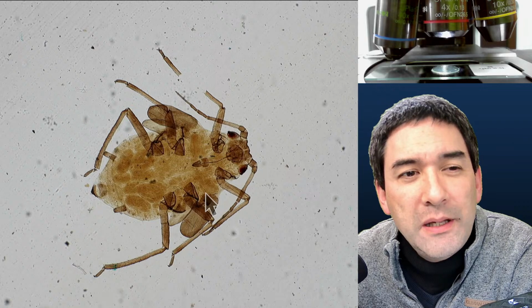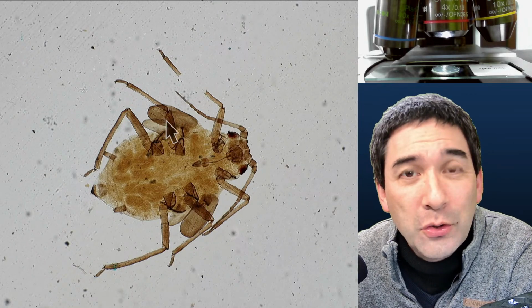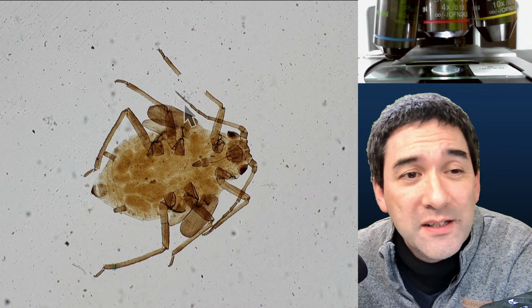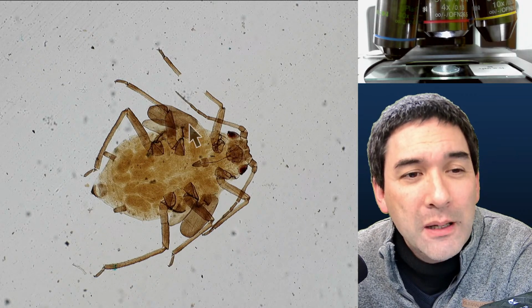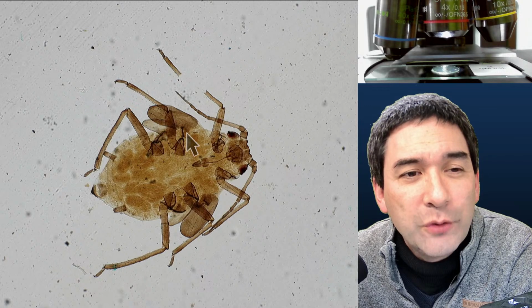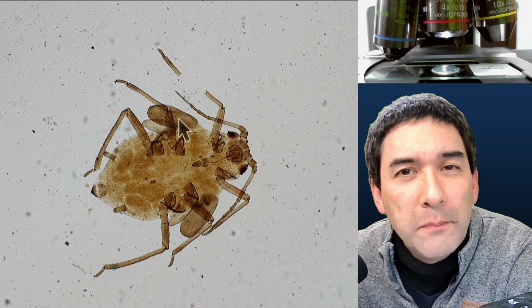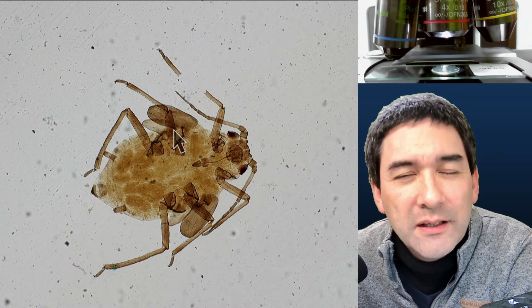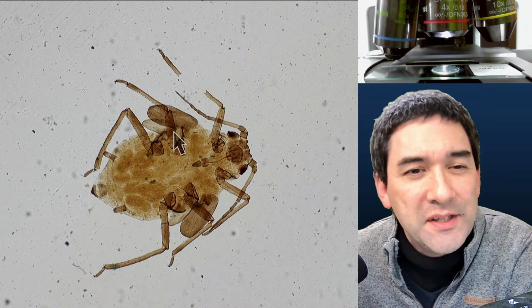Those appear to be basically the two pairs of wings that now are not used for flying anymore, because the aphids don't fly around anymore, but just sit on the leaves and suck the sap. But look, that's basically whatever is left over of the wings, because one characteristic is that there are two pairs of wings present. Now, flies only have one visible pair of wings. I'm going to talk about this as well.